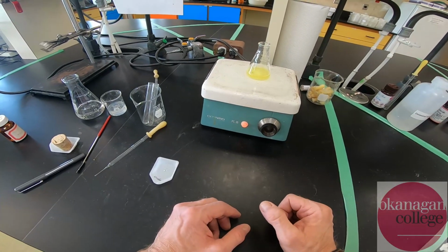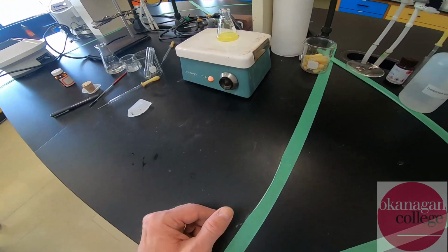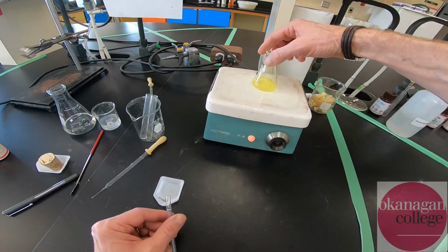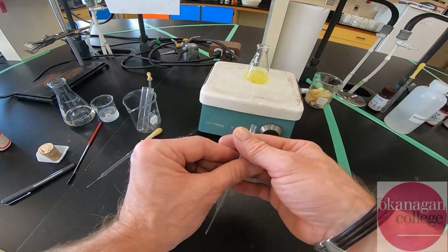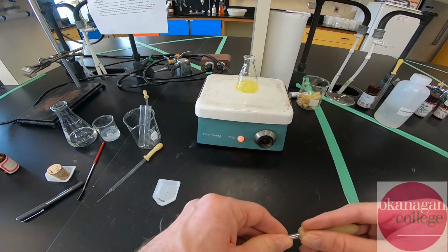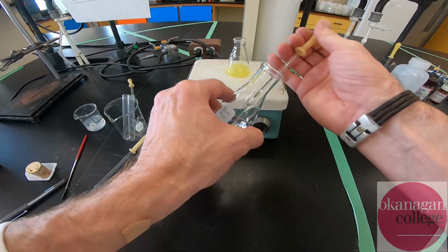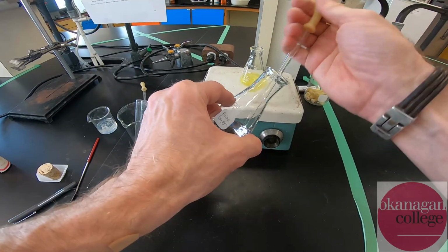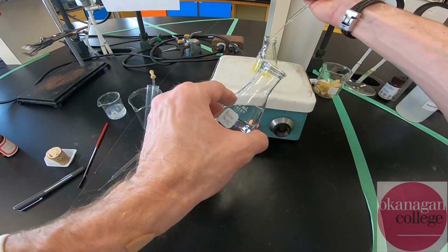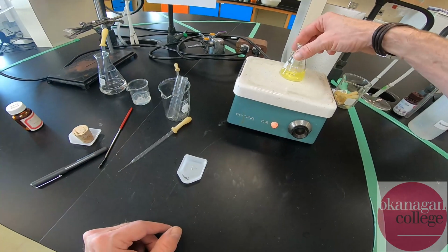All right, so it looks like we have reasonably good boiling here. And at this point, it still looks like there is a modest amount of material undissolved. So I am going to go ahead and add a couple more pipettes of solvent. That ensures that the solvent we're losing through evaporation is replaced, but it also adds a little extra solvent so that we can ensure that we dissolve all our material. So that's 2, 4. I'm going to add another 6 mils of solvent. Okay. So at this point, I believe I'm upwards of around 20 mils of solvent.